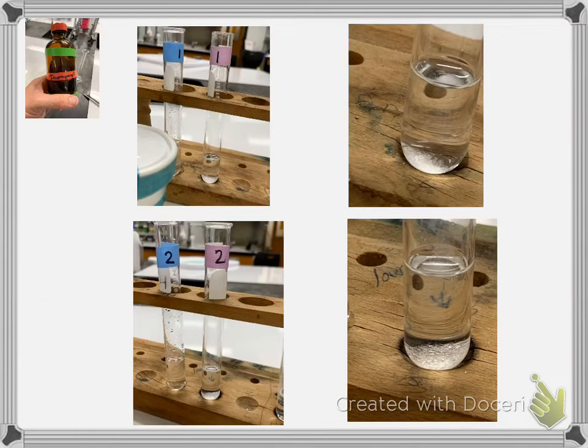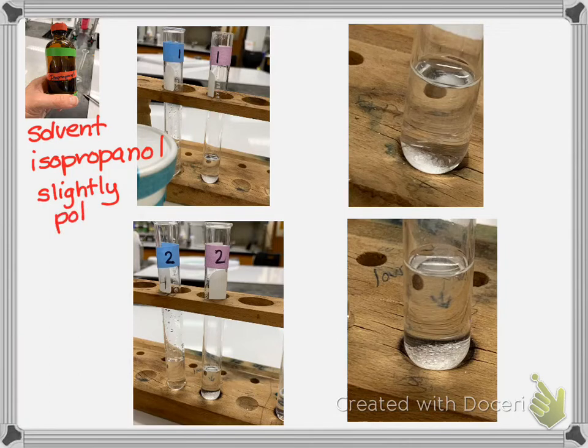So our second solvent, I happened to take a picture of it, so I put it here in the corner, is isopropanol. It's an alcohol, and alcohols have an OH, so there's a part of an alcohol that is polar. But they also have carbons and hydrogens, which are nonpolar. So this can be slightly polar, but it's not going to be as polar as water. So it will also have some nonpolar characteristics. It will be interesting to see, when we're thinking about like dissolves like, which means the closer things are in polarity, the more likely they are to dissolve.